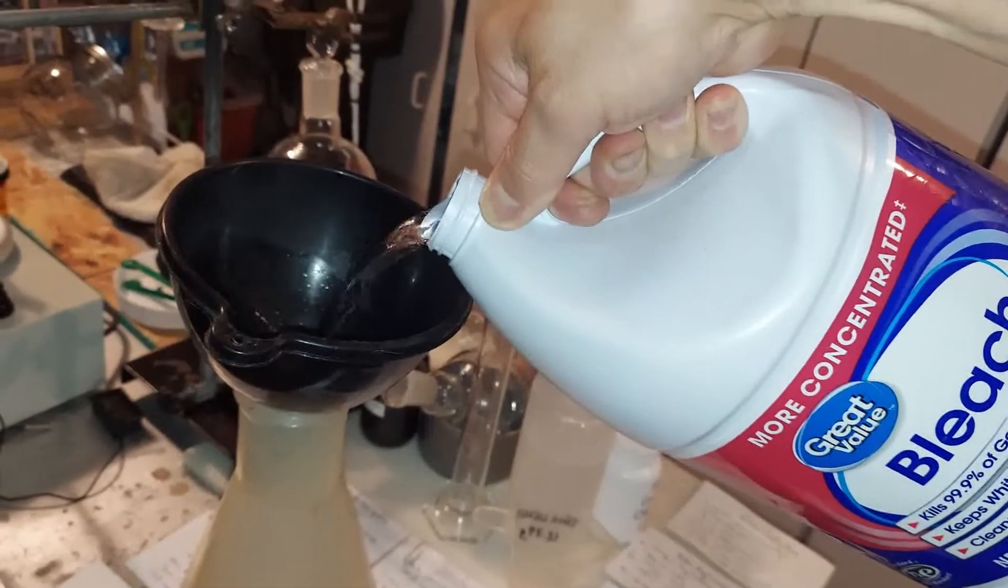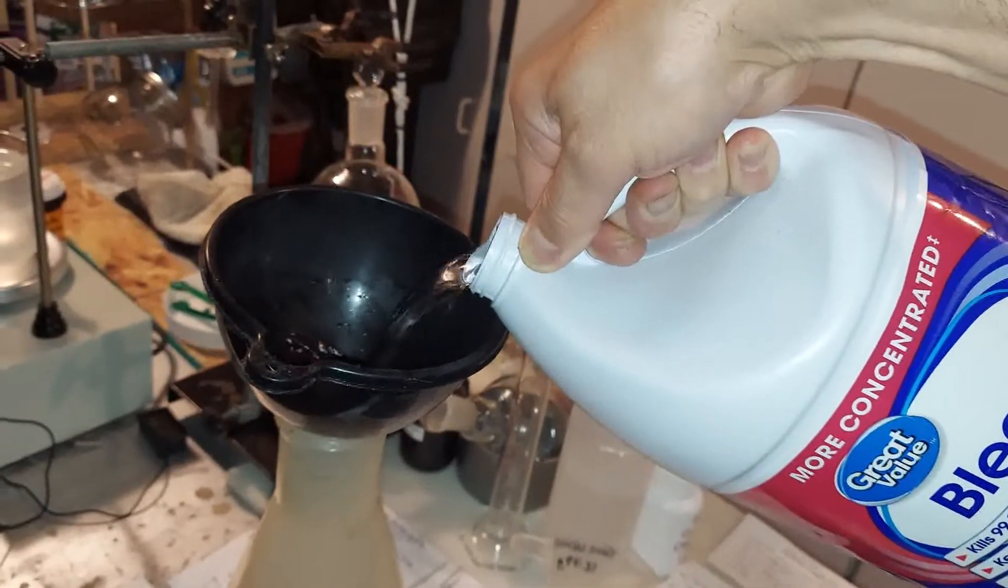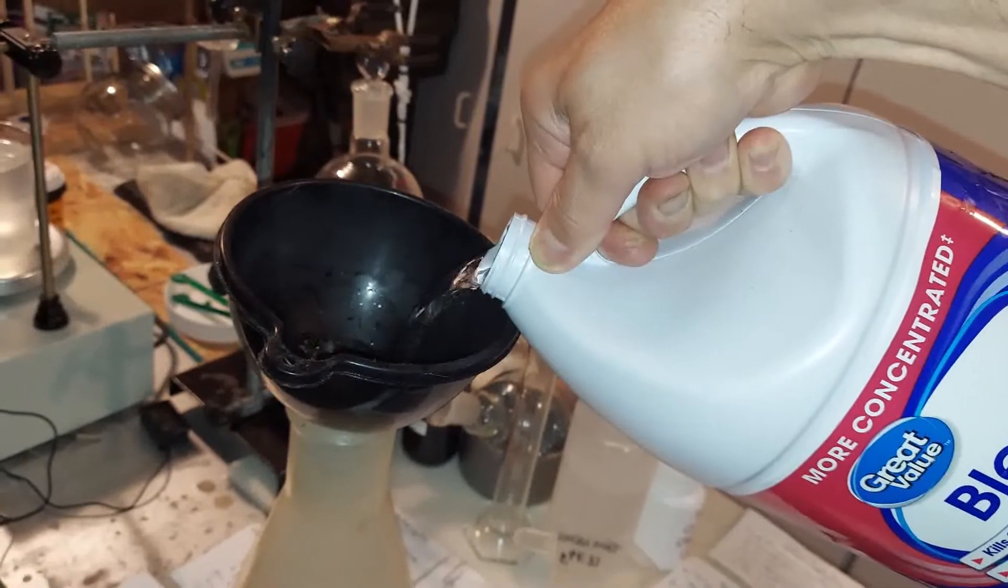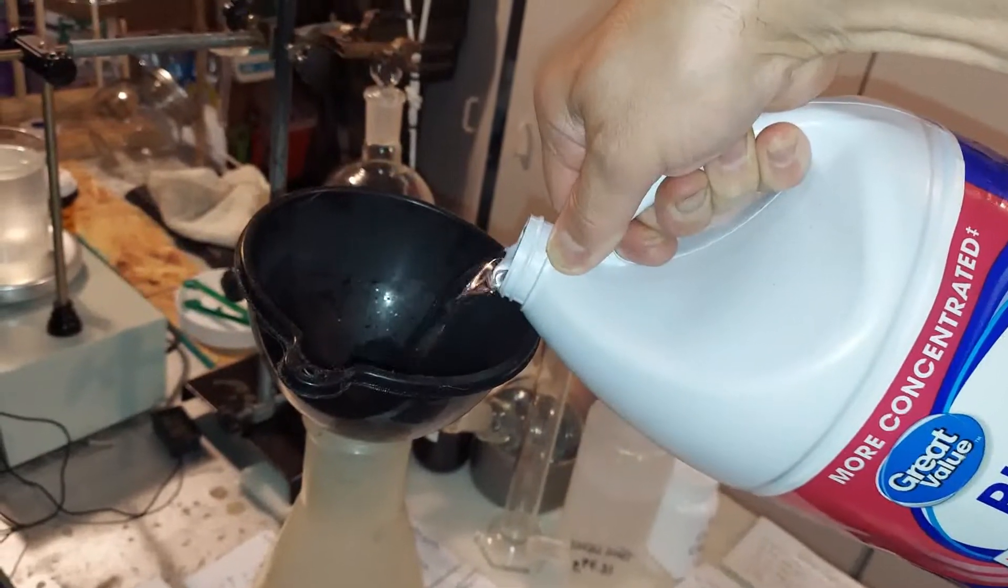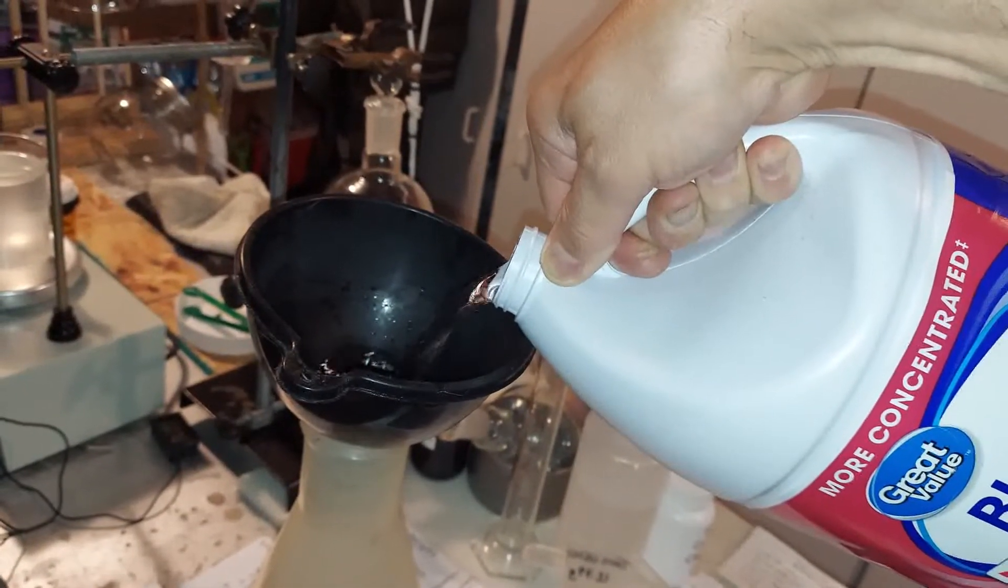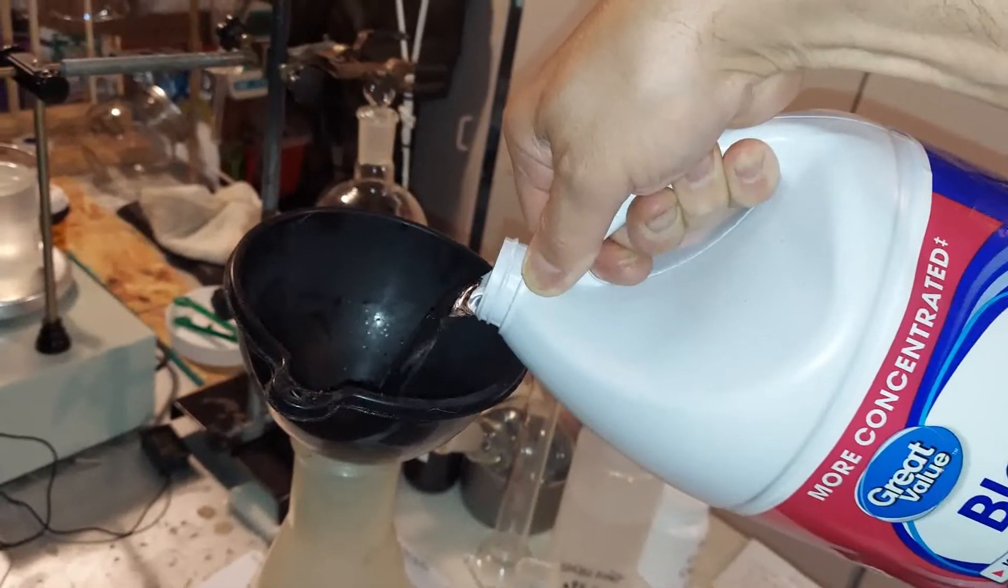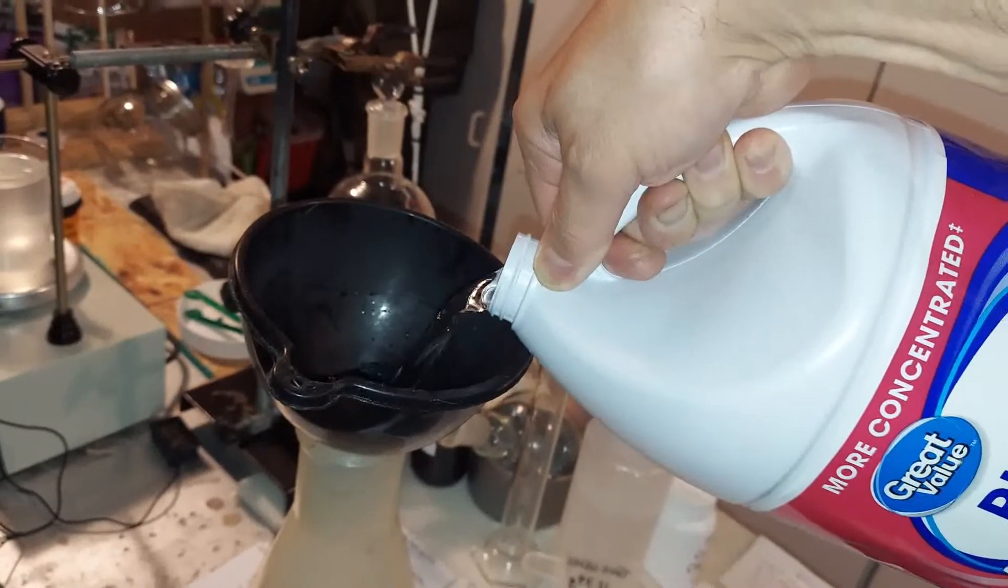You can see it's steaming a little bit out of there. We just want the last bit, which we'll put in the separatory funnel, which will contain the chloroform. Chloroform sits on the bottom of this.